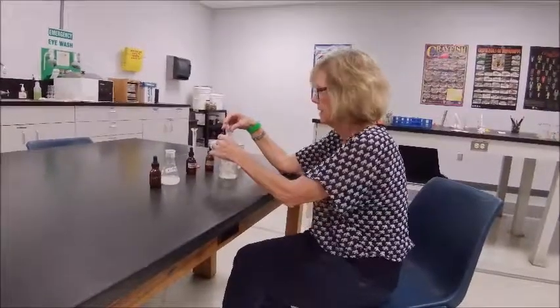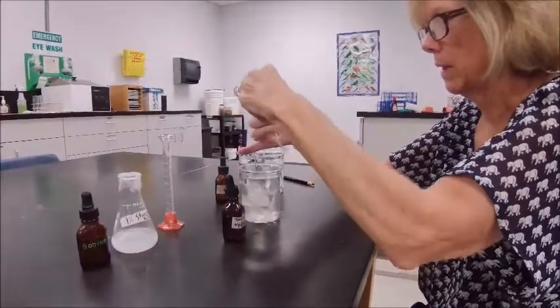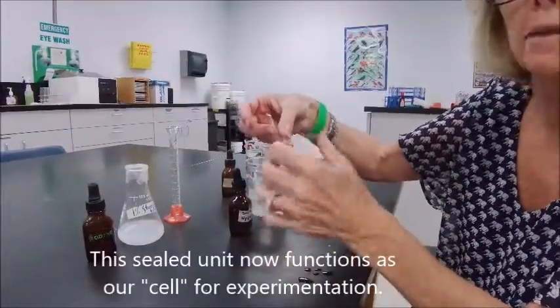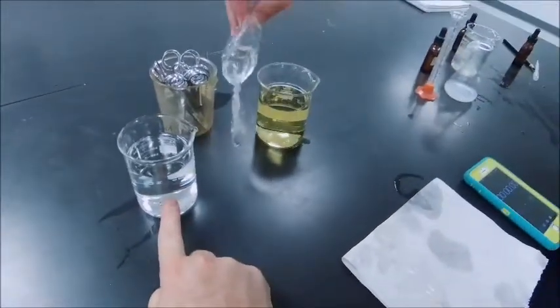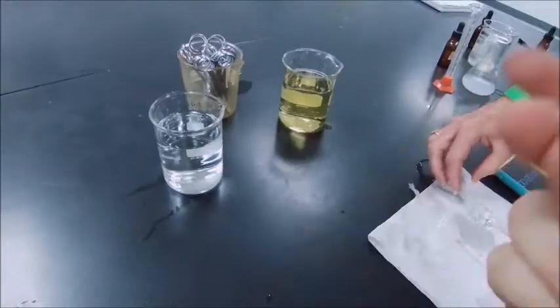We can see a bag being filled. The knots are pulled tight and the dialysis tubing is twisted before tying to prevent leaking. We have a bag with phenolphthalein, which is transparent, and a bag with starch, which has a milky appearance. Sodium hydroxide is in one beaker, phenolphthalein in another, and iodine in another. The starch bag setup is being recorded on a time lapse so the diffusion can be seen in real time.